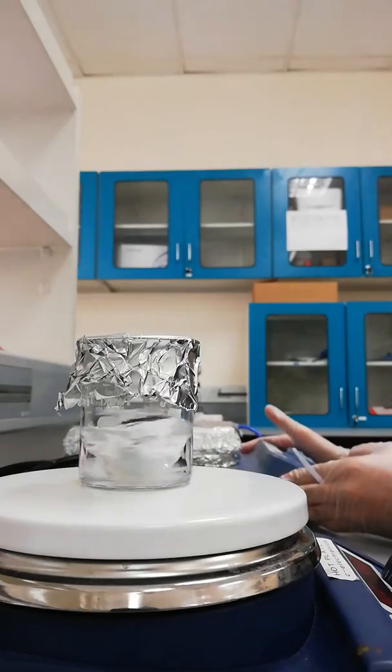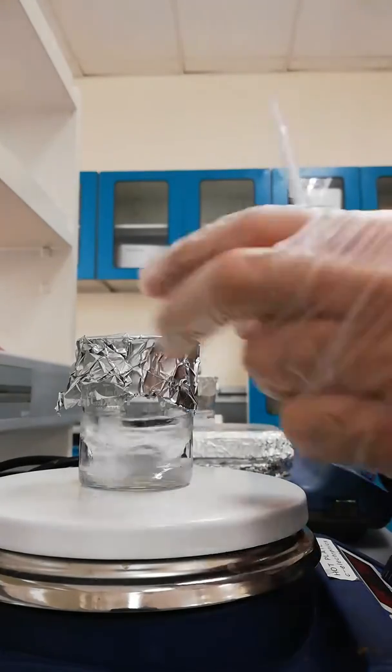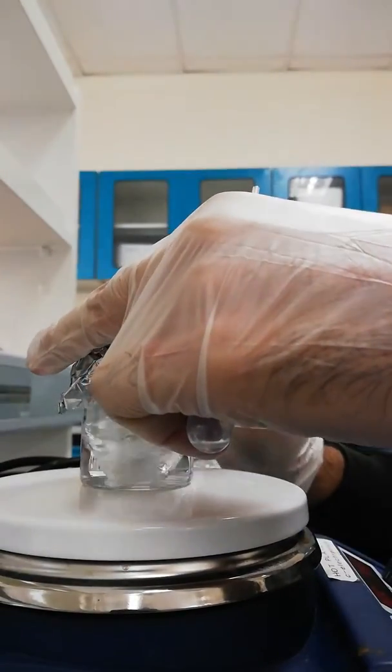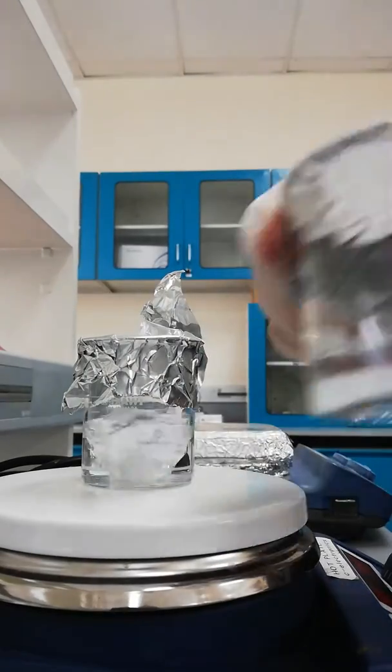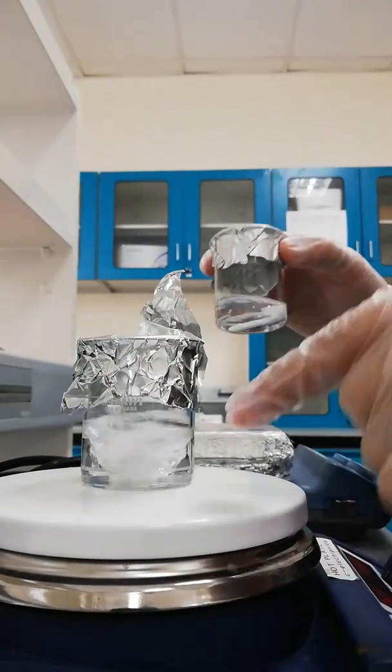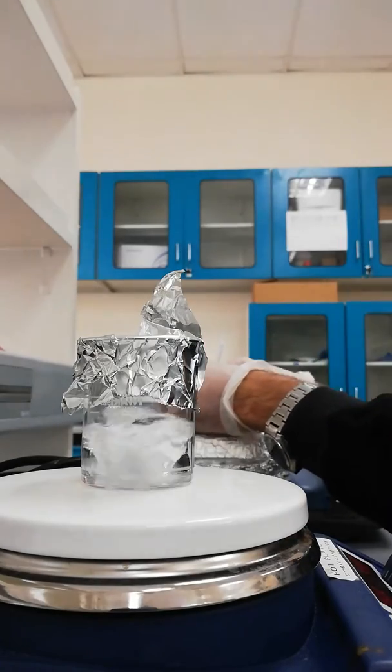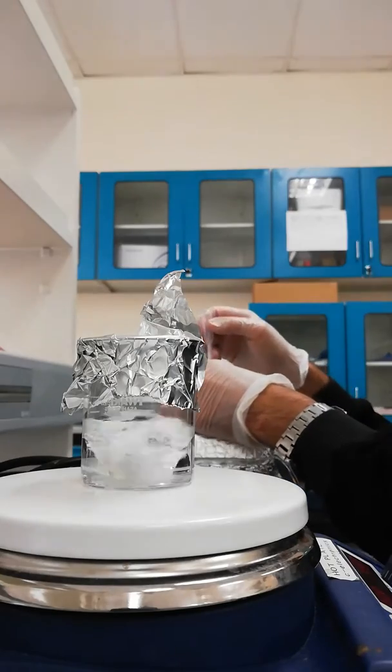I want this solution to be whitish first and then it should disappear. It's whitish after adding sodium hydroxide dropwise into zinc acetate. I have heated both solutions for about 45 minutes, heating zinc acetate at 60 degrees.